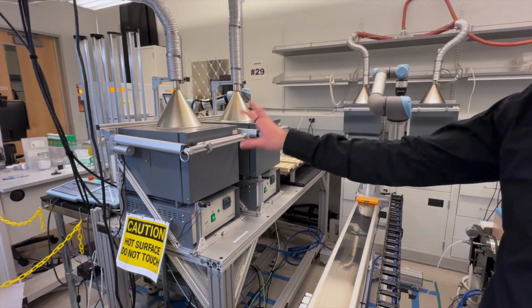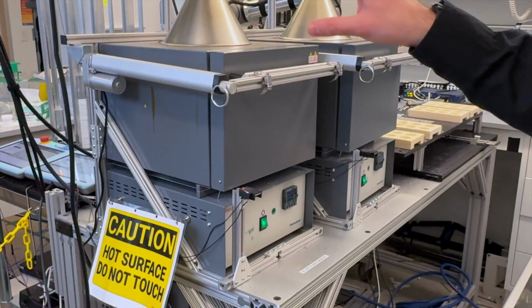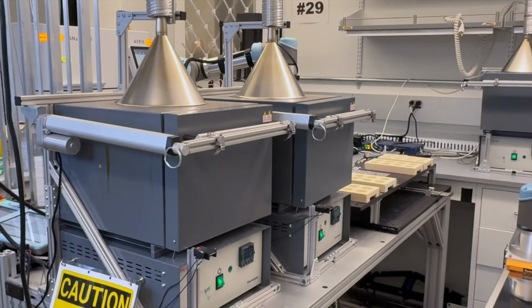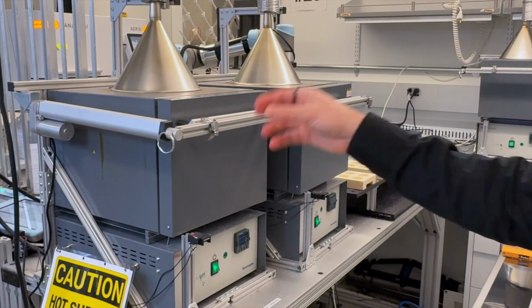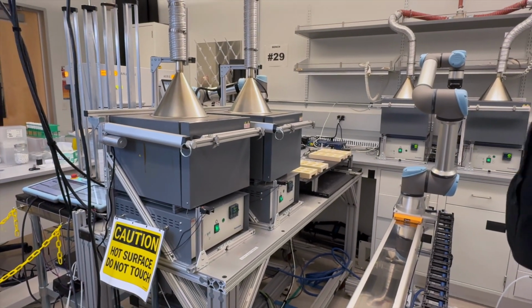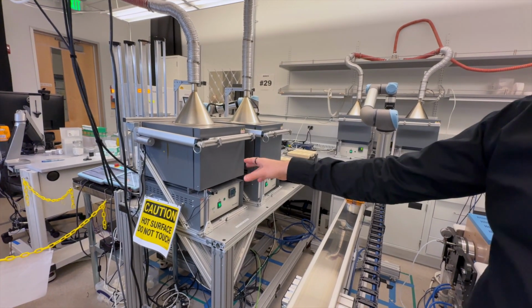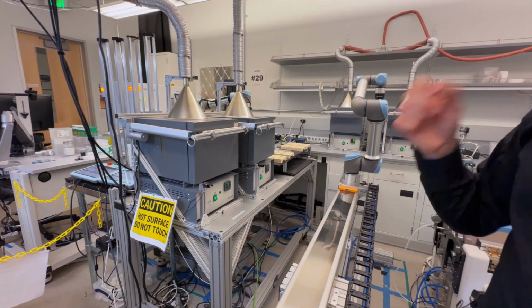It's just an aluminum structure. In this case, a sensor here for the door. There's already a sensor inside this linear actuator that turns it off automatically when retracting. And the reason why we stop in between with the sensor is because even though there's a sensor to stop it when it's fully extended, we are not fully extending. We have to stop in between. And then we have this safety pin here. If someone needs to open this, they can just pull the pin and open the door immediately for any safety concerns.